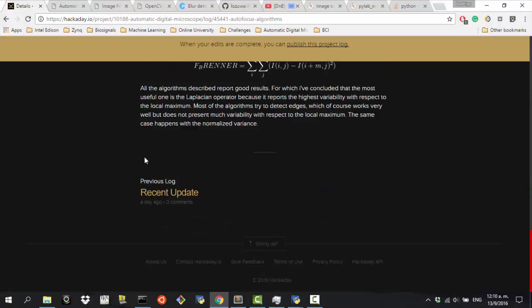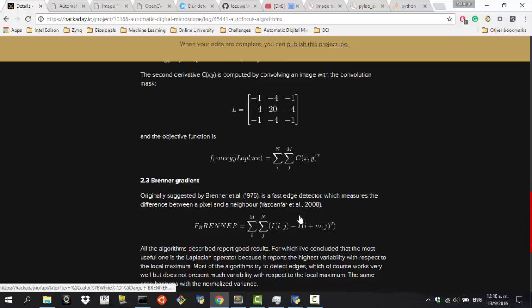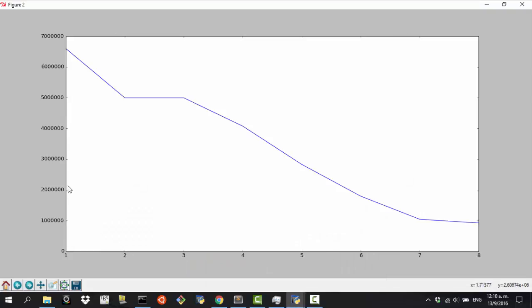We should use big O notation to make this work, and I don't know why it takes so much time. It is just O of n times m, and that's 307,200 pixels, so it's not that much, but still we just have very good values with the variance. And it's of course faster than this algorithm, so we're going to take that algorithm.